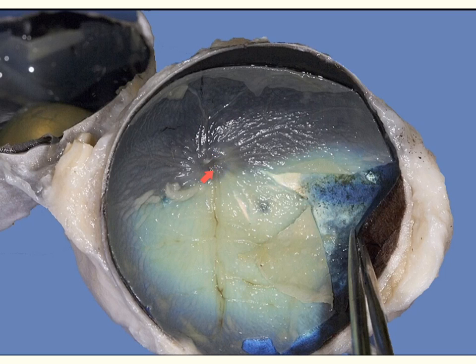Reviewing brain anatomy: from the brain we have the optic tract, and as the optic tracts cross we have the optic chiasma, then from the optic chiasma it continues as the optic nerve. That optic nerve comes from the brain all the way to the back of the eye, and once it enters the eye it is no longer called the optic nerve — it spreads out and forms the retina. The retina is the photoreceptor of the eye, containing rods and cones: rods function mainly in dim light providing black-and-white vision, while cones support daytime vision and color perception.